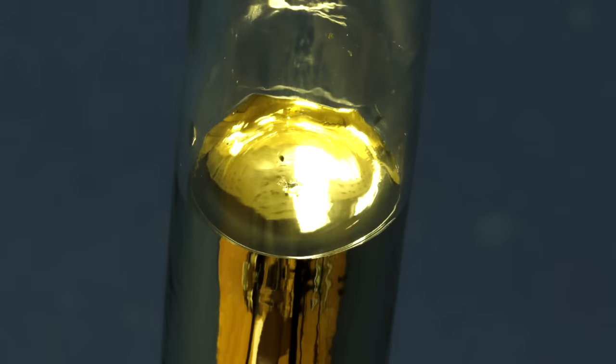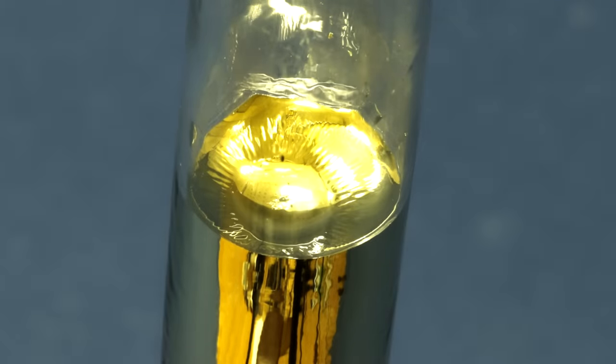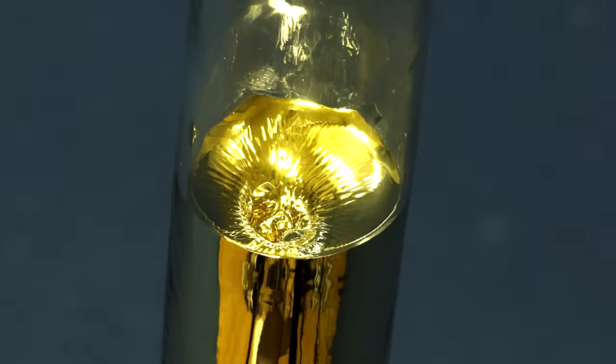Also, due to cesium's solidification, its volume is being significantly reduced, as can be clearly seen with the funnel formed from solidified cesium in the ampoule.